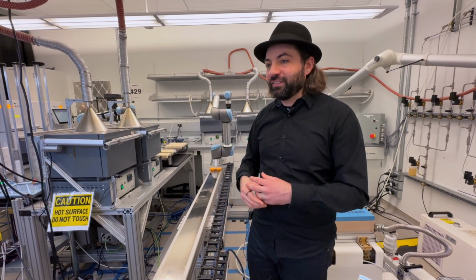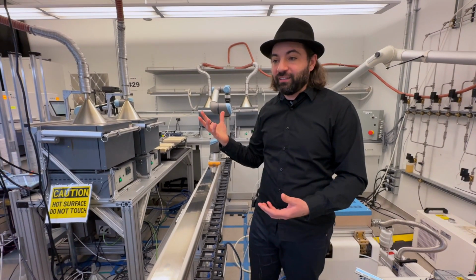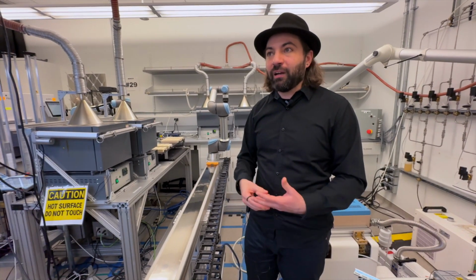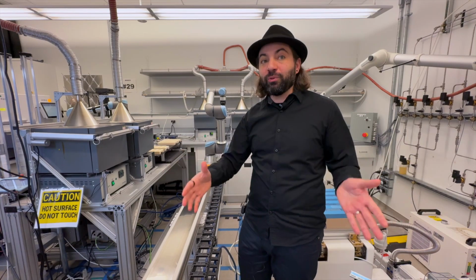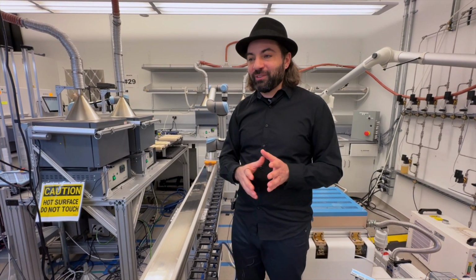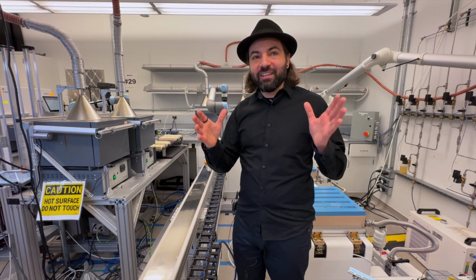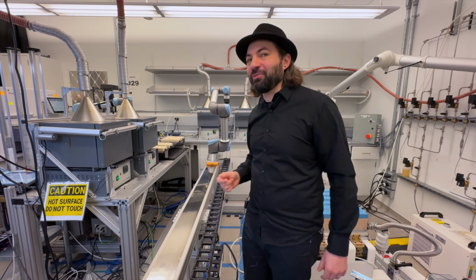And then you can have the safety devices, whose clock speed is way higher. So we can trust that these machines are actually protecting our lives around these strong motors. Imagine the size of the motor to move an elevator, right? You don't want that motor being controlled by something that is not very fast to know immediately that something is wrong. Wow.